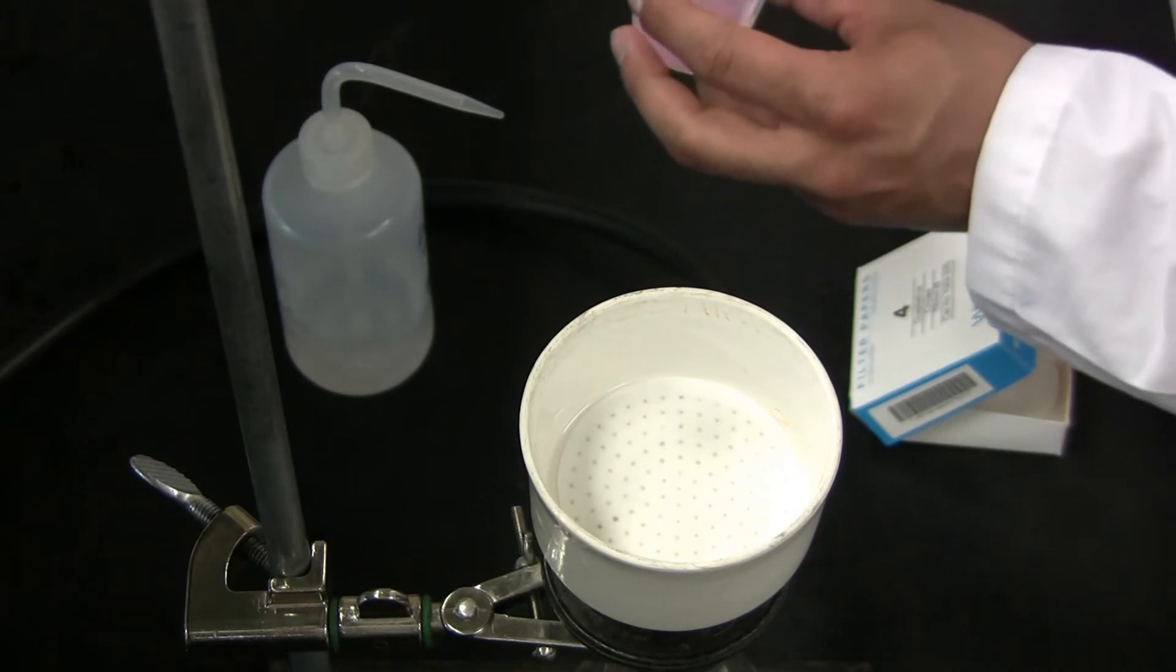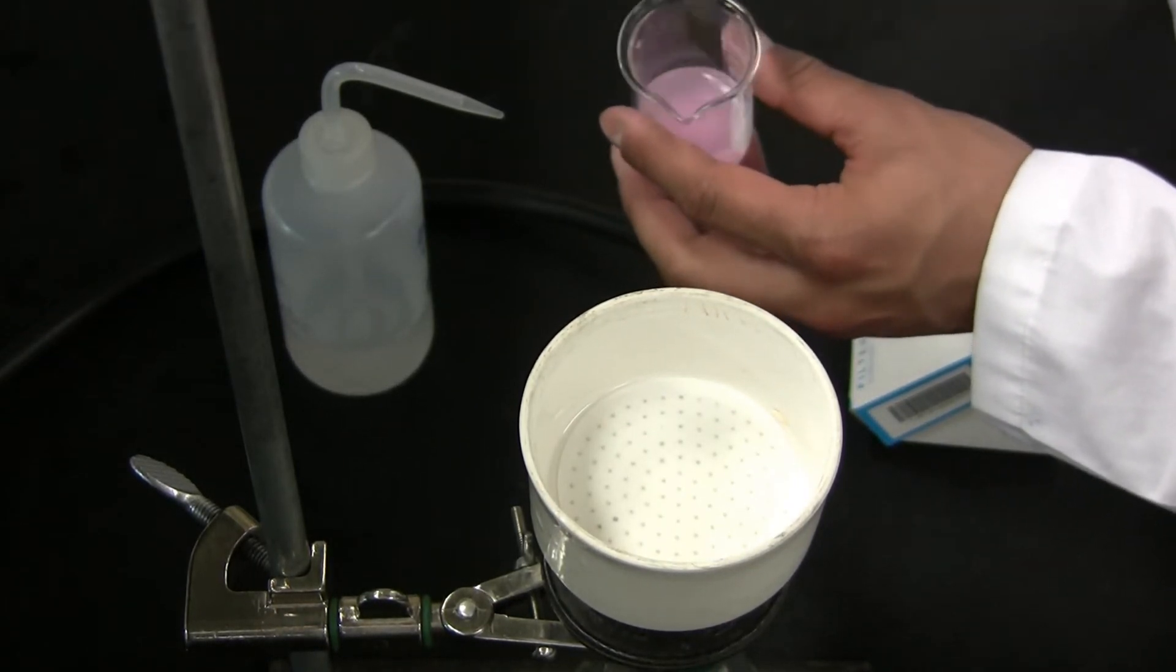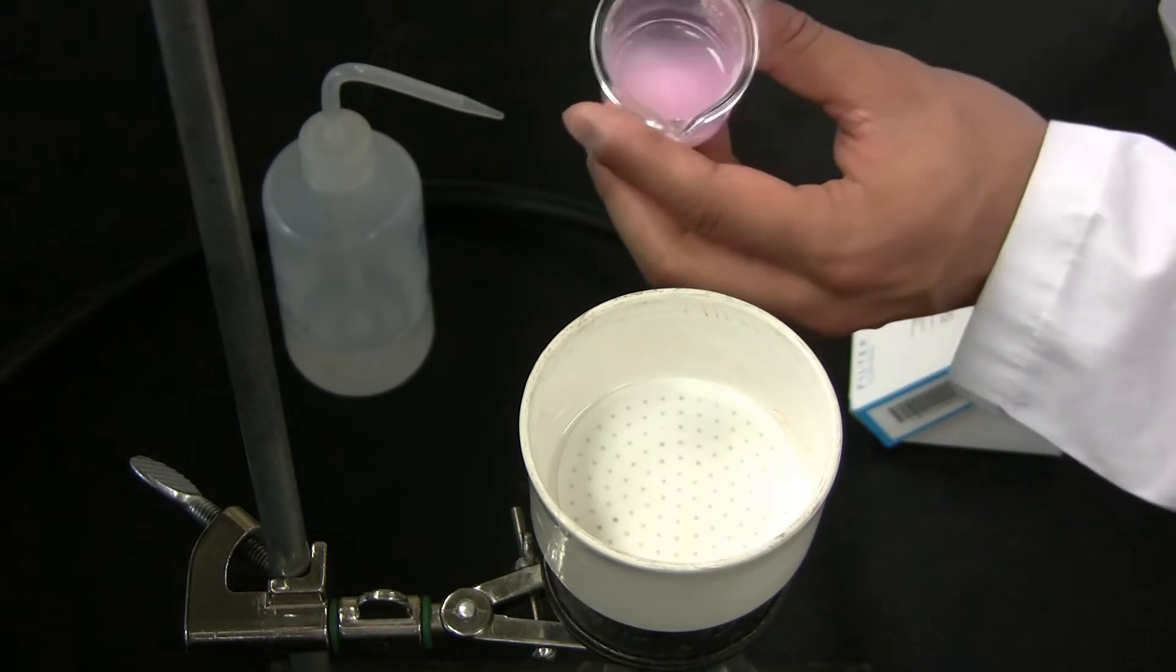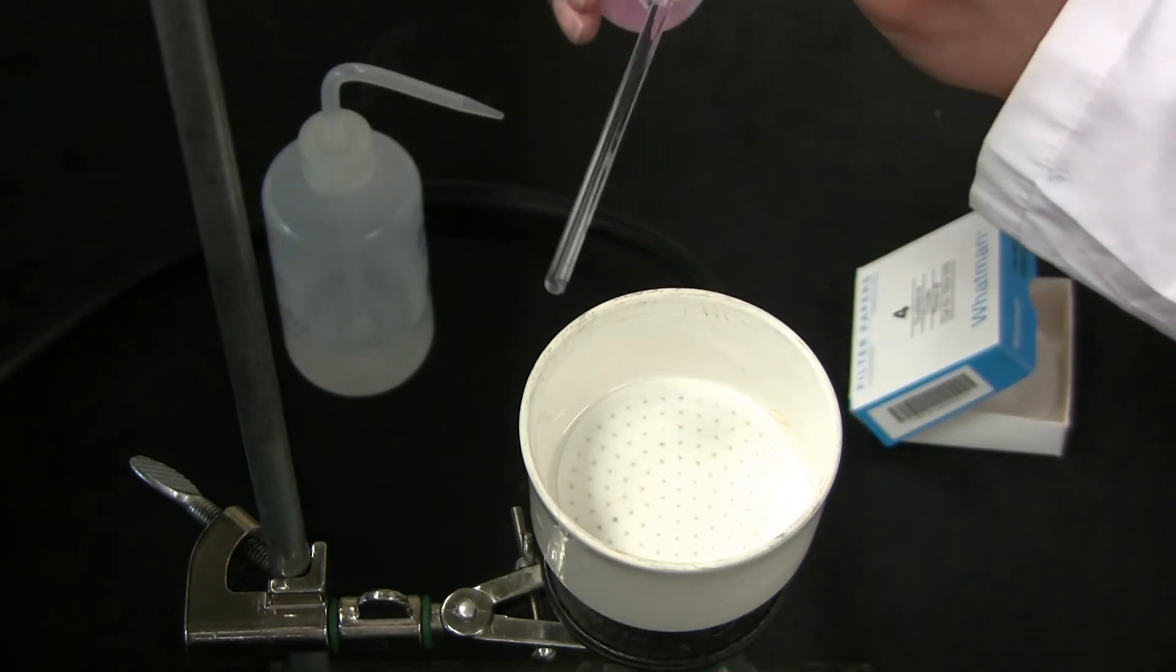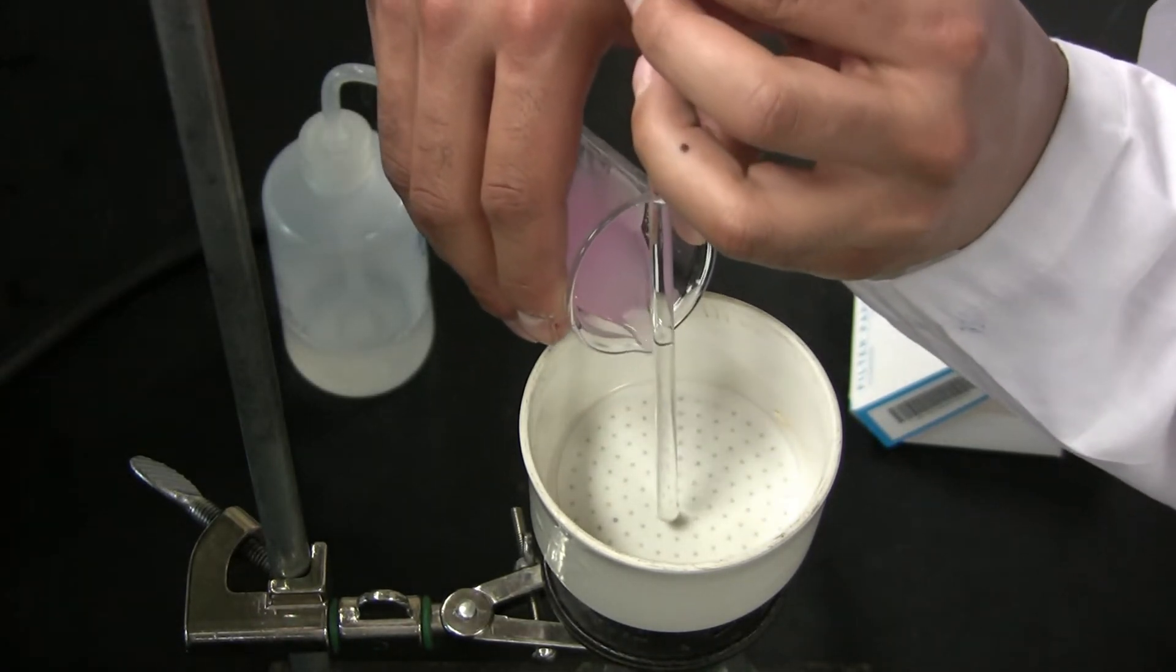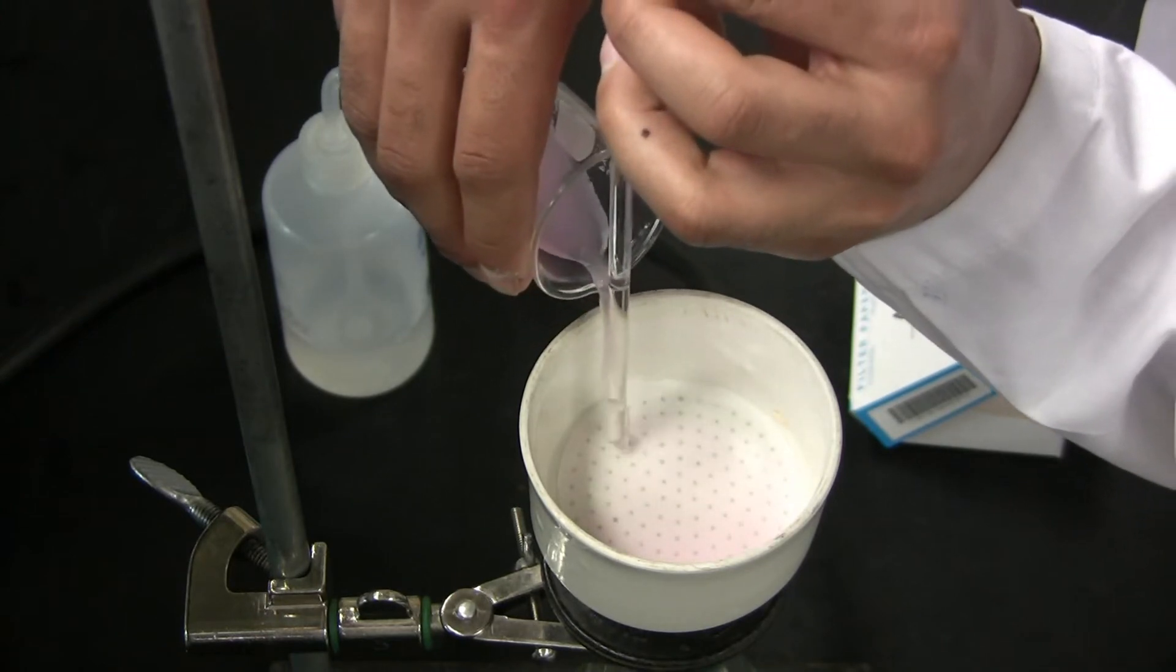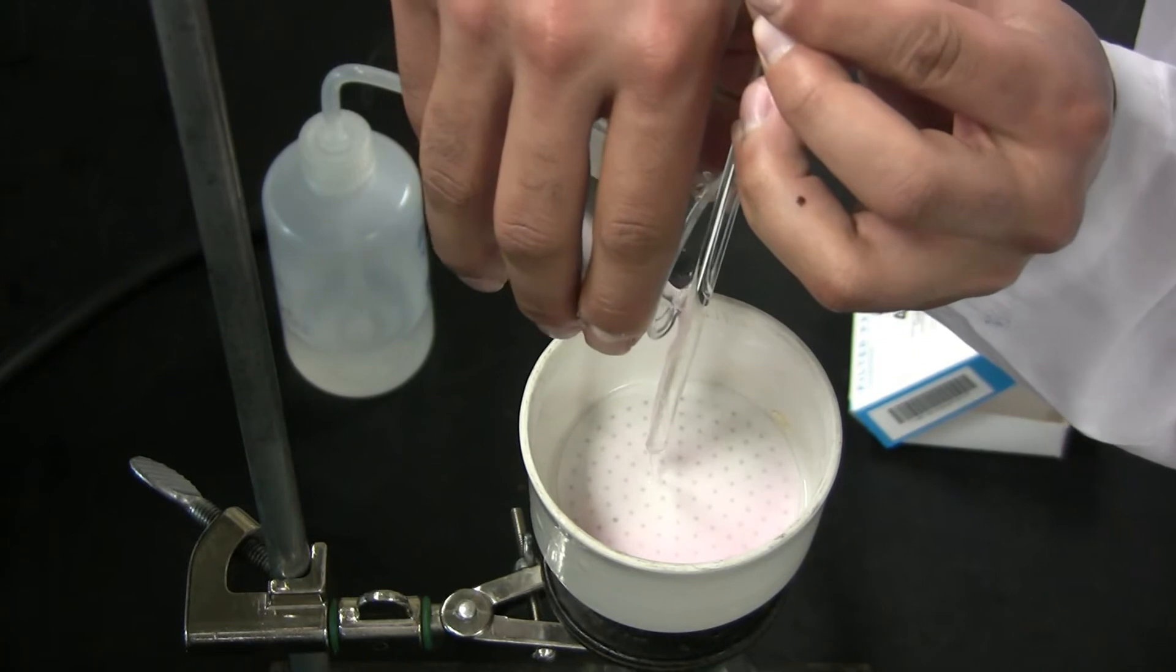Taking your rubber policeman, stir up the settled solids at the bottom of your solution. Then slowly pour them into the Buchner funnel with the glass stir rod. Make sure that none of the solution or crystals end up on the outside of the filter paper.